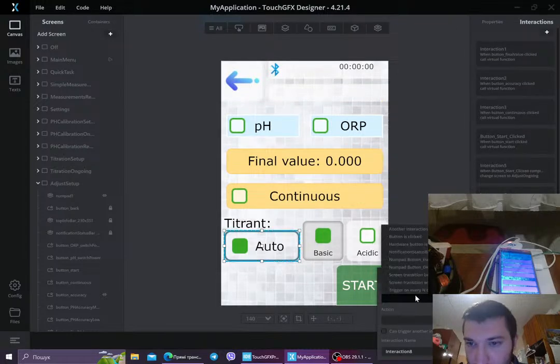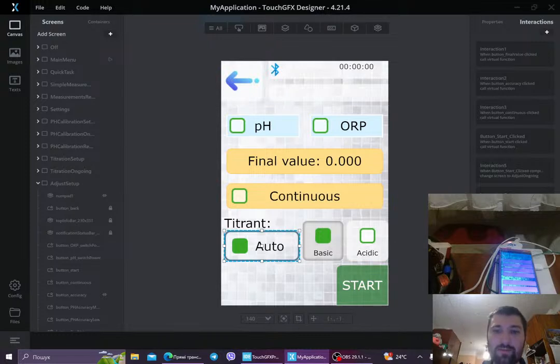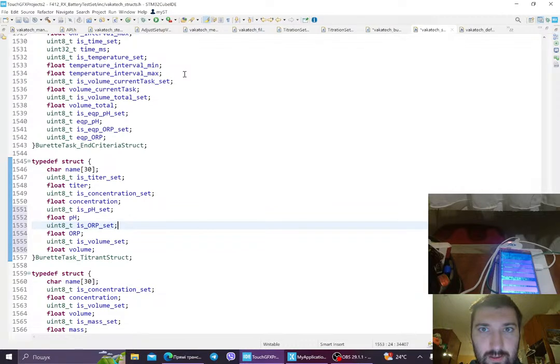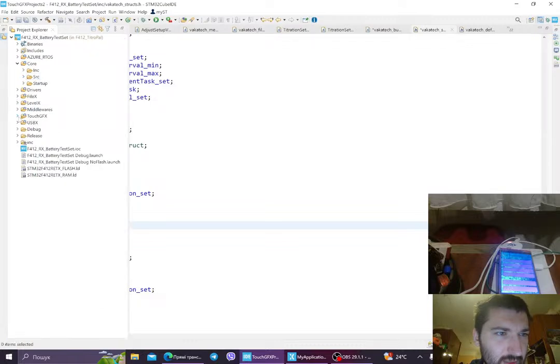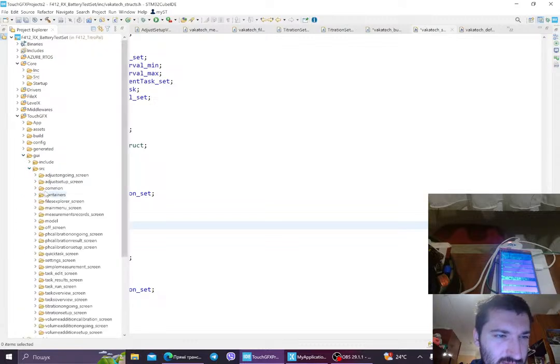And finally we're gonna have acidic. Button is clicked, button titrator acidic, call new virtual function, acidic, control copy. Yeah, so we have all of this. Now we have 3 virtual functions, and they're gonna be defined in, let's go here, let's close this, in TouchGFX, in GUI source.